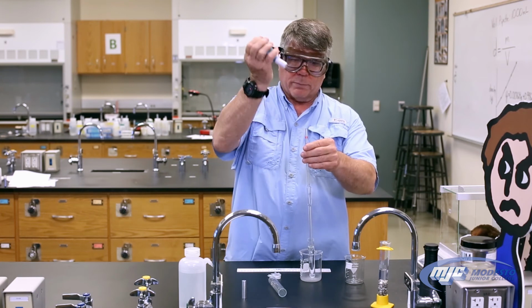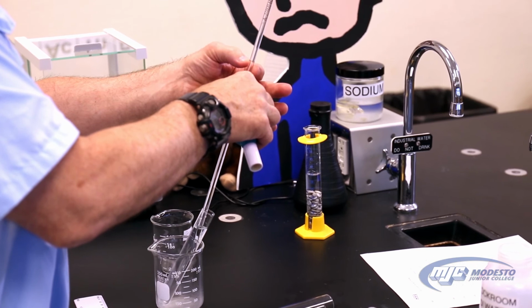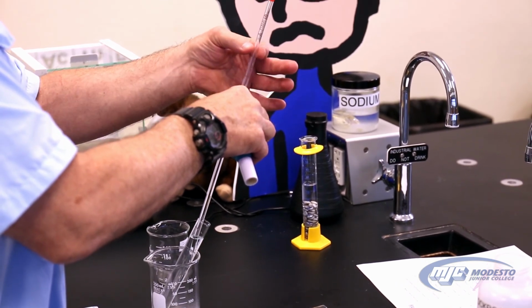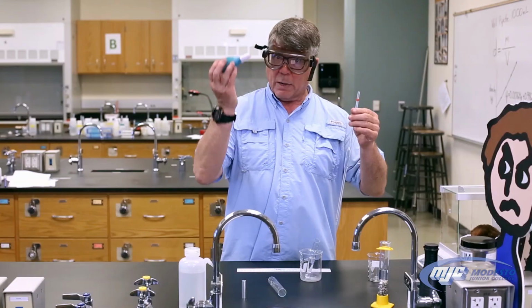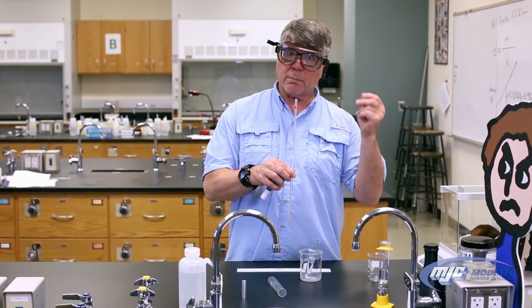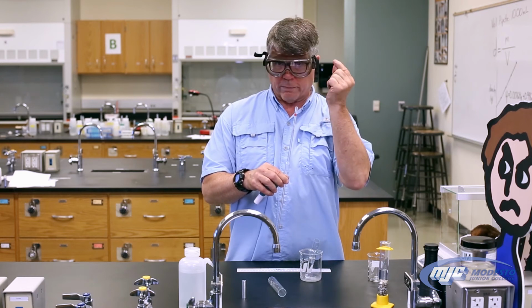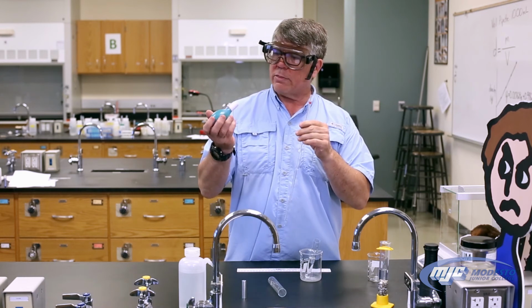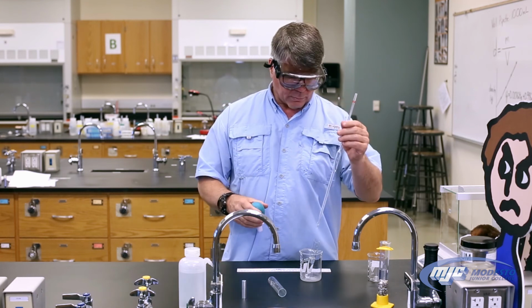So with a pipette, remember there's a mark up here on the neck somewhere. We want the bottom of the meniscus just touching that. So we're going to pull the solution up above there somewhere and then adjust it down. Pipette bulb, pipette. So again, remember with this, you want to make sure that the pipette is dry, the top of it, your forefinger is dry, and the pipette bulb is dry. Because if any of those are wet, this part's pretty much impossible.